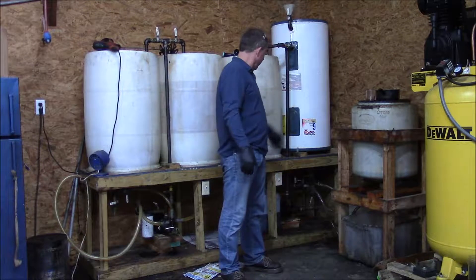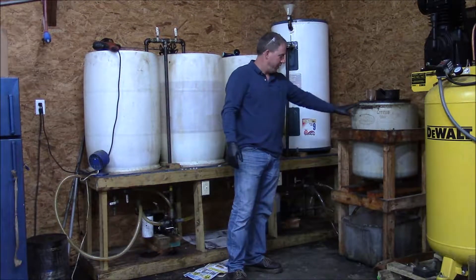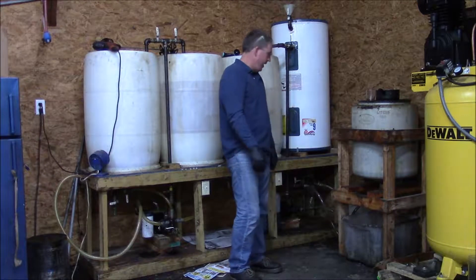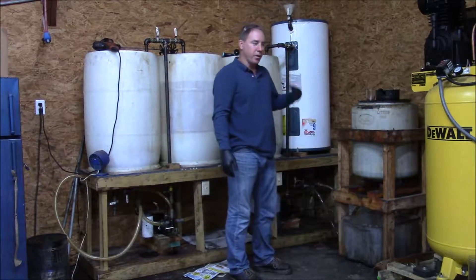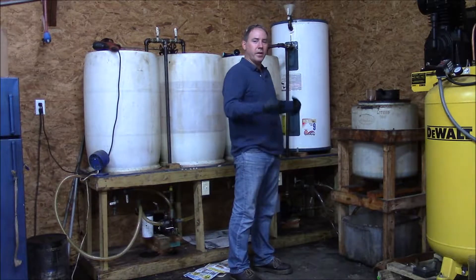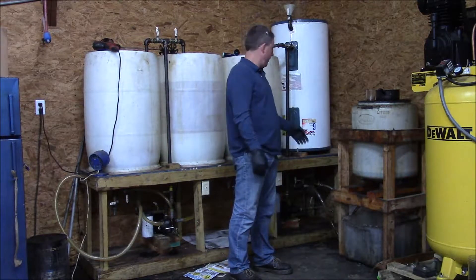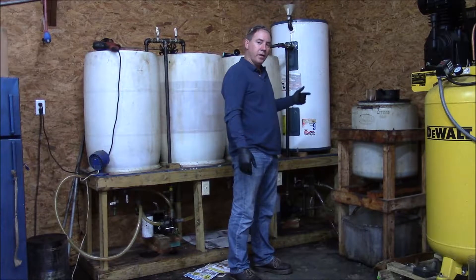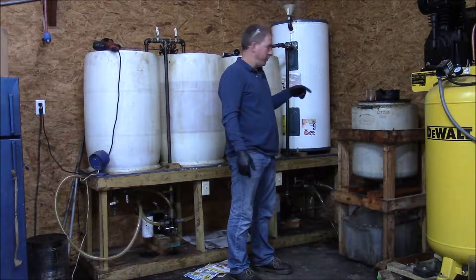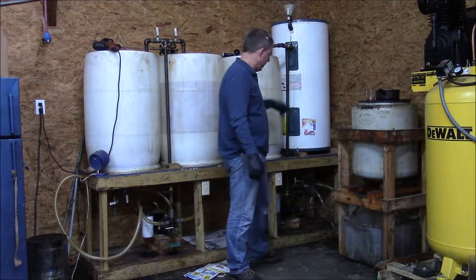Earlier we went ahead and drew our material in from the primary vessel into the processor. Now what we need to do is circulate the product in the processor, get it nicely mixed up really well, and then I'm going to take a sample out of here and we can titrate that sample. So what I'm going to do now is go ahead and start the cycling process.